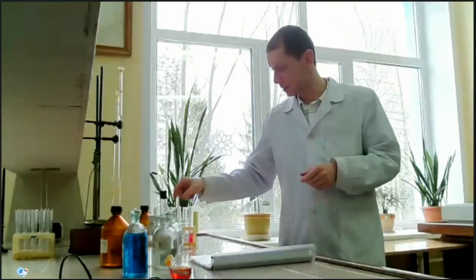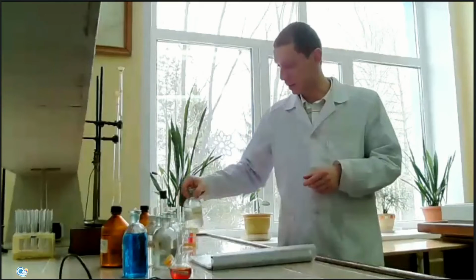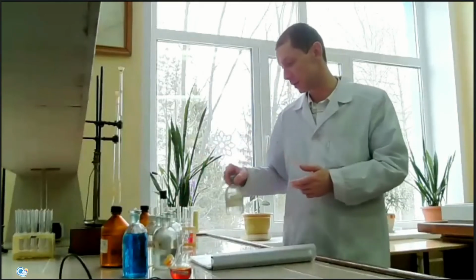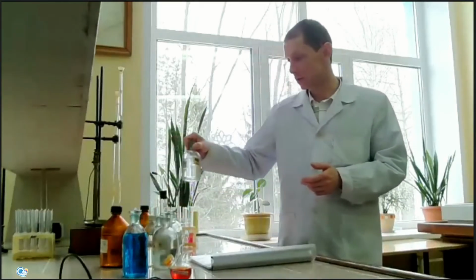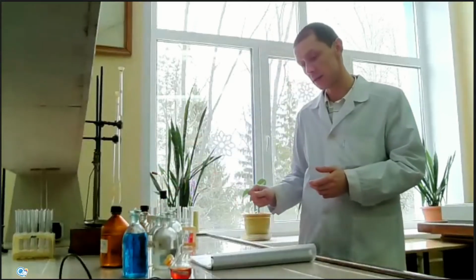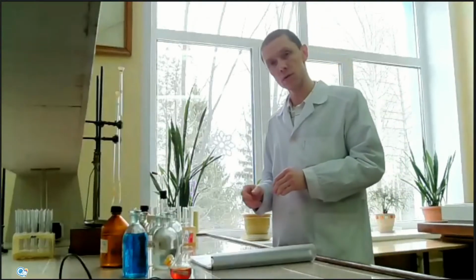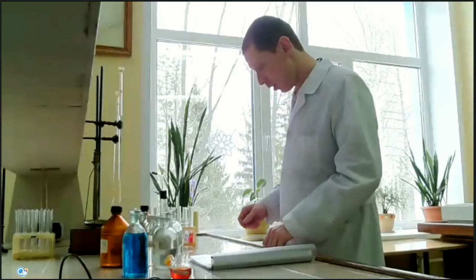It's because acetic acid is a weak acid, and sodium acetate reacts with strong acids like HCl. The product of this reaction will be acetic acid, and the smell of vinegar, I think you know what smell it is. Okay, next reaction.